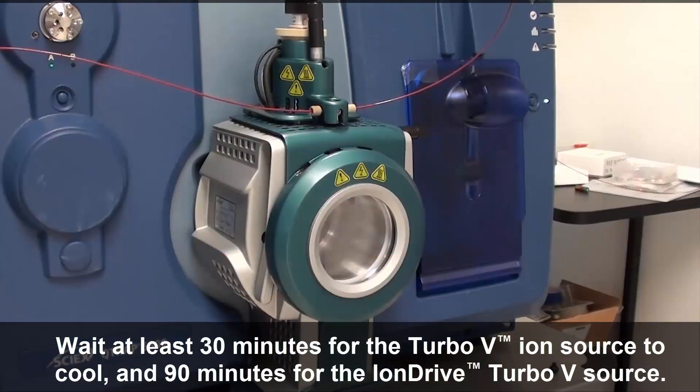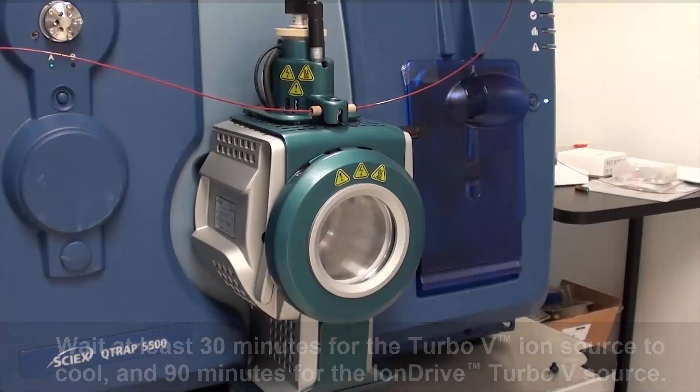Wait at least 30 minutes for the turbo V-ion source to cool and 90 minutes for the ion-drive turbo V-source.